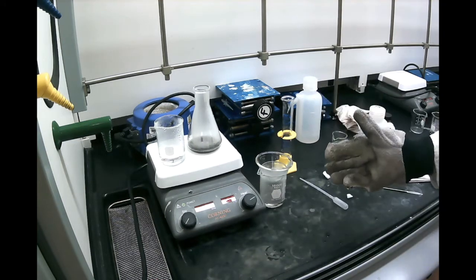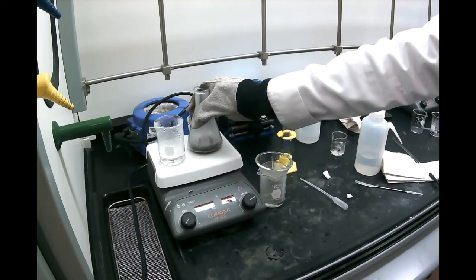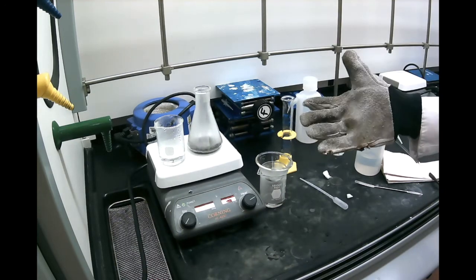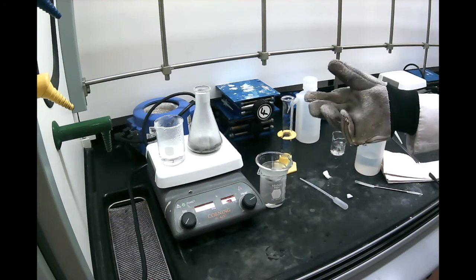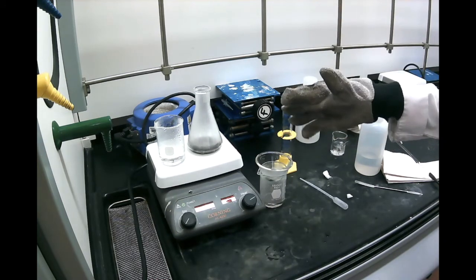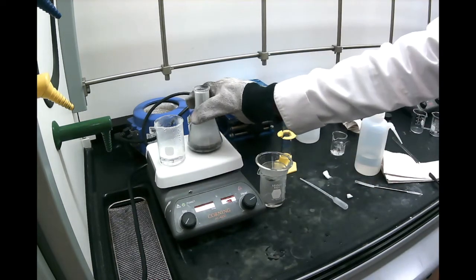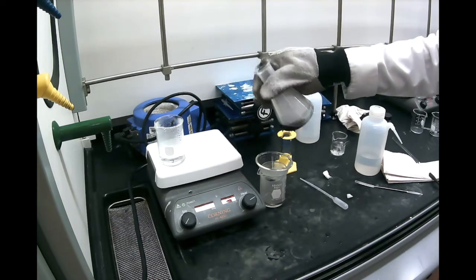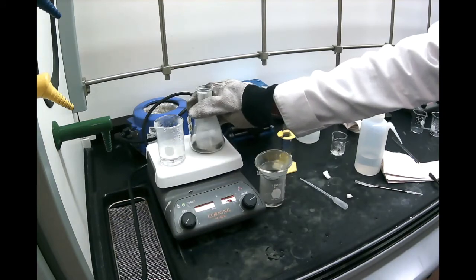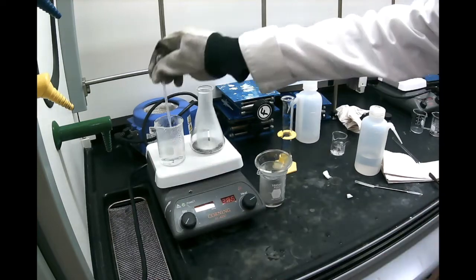So we're going to keep adding, and this is the trickiest part of the whole recrystallization. This is really the hardest one, because that's where you're going to lose most of your chemicals if you're not careful. The cotton can be too much and it will crystallize on the surface, or you added too much charcoal and it absorbed some of your substance. So that's why recrystallization is really more an art than a science itself. It takes some practice to get really good at these things.